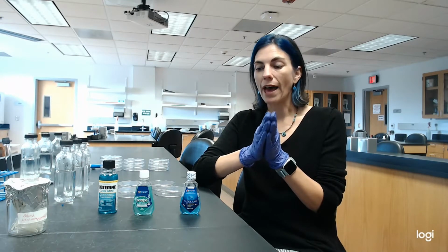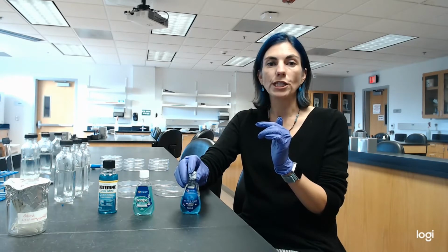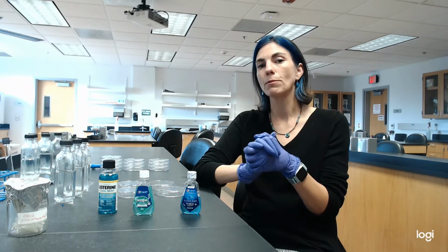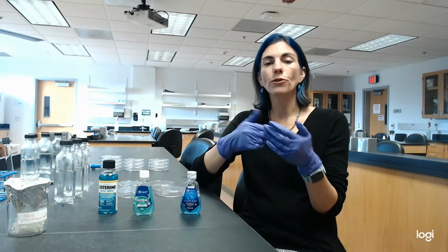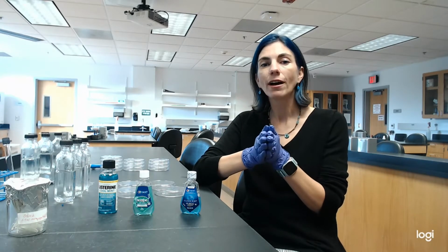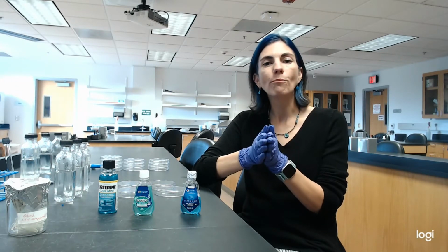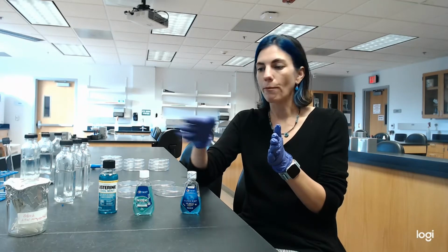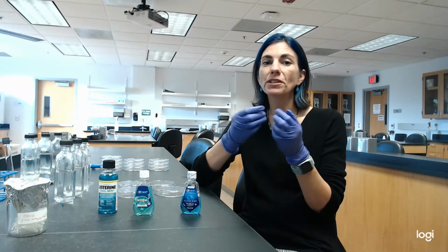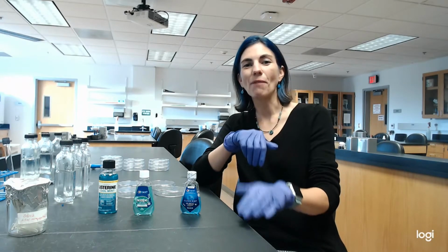So in order to do that, I need to make sure that I mix my saliva with the mouthwash for the prescribed time. And when I'm looking at the instructions on these, the prescribed time looks to be about 30 seconds of gargling. So to most accurately mimic that, the way that I'm going to do this experiment is I'm going to use half a milliliter of saliva with half a milliliter of whatever mouthwash is there, or water for the control. And I'm only going to let them sit for 30 seconds before I start my serial dilutions. So I'm going to go collect some spit and then I'll be right back.